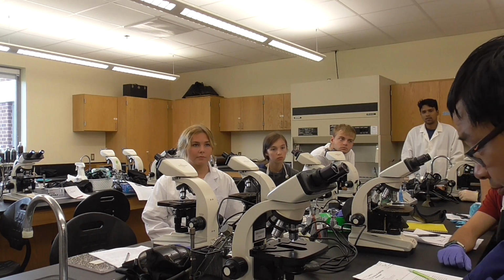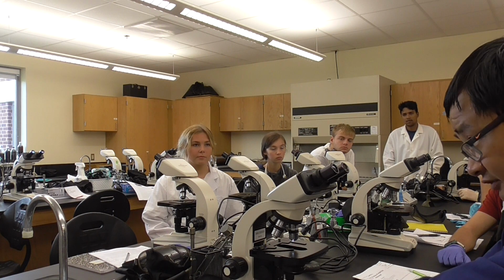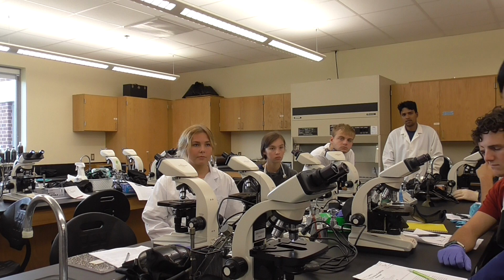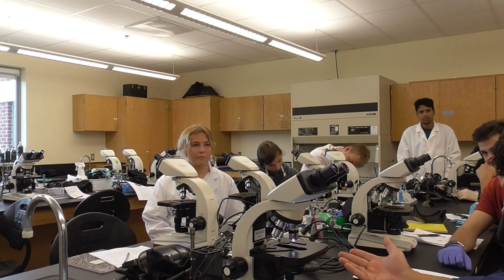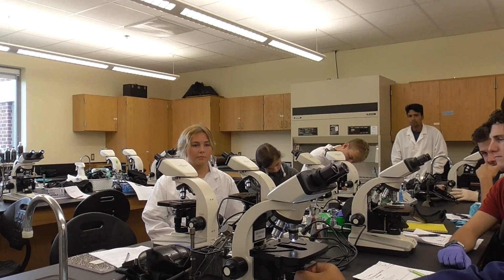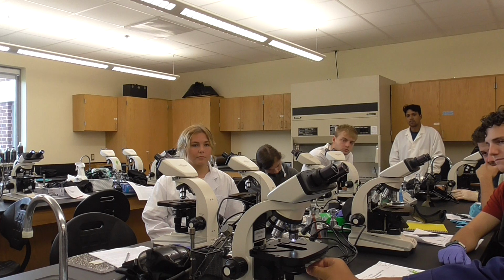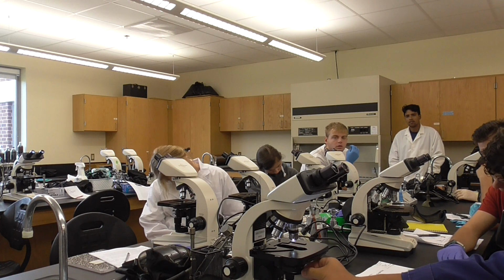Some microscopes have a control panel right here to adjust the amount of light, but this one you cannot. Another very important thing is back here, which you can move around. This is called the iris diaphragm, which controls how much light goes through the lens to the specimen. If you use 10x, you always set it at 10x. When you use 100x, you always go to 100x.